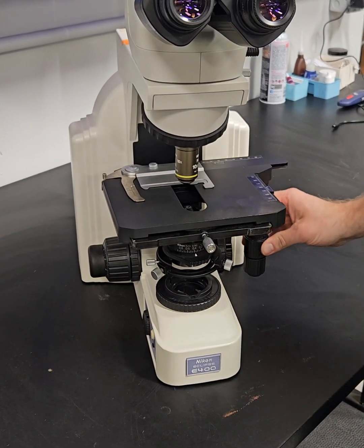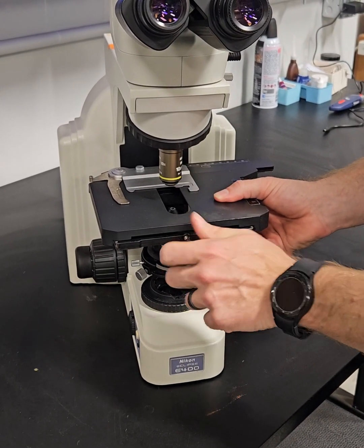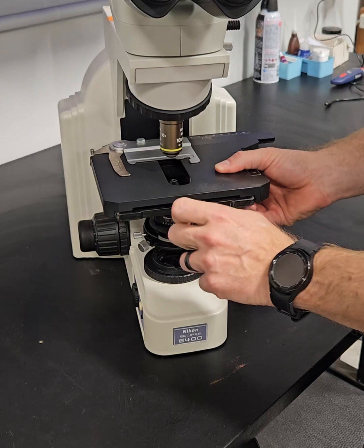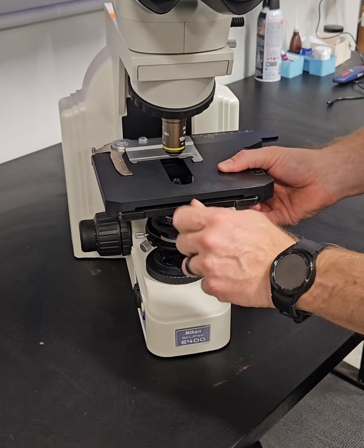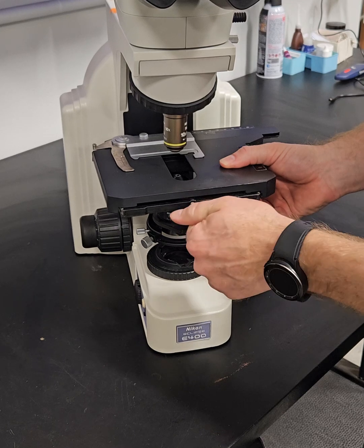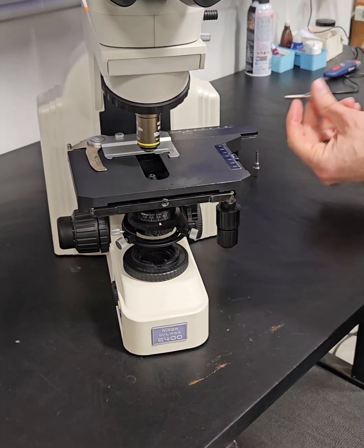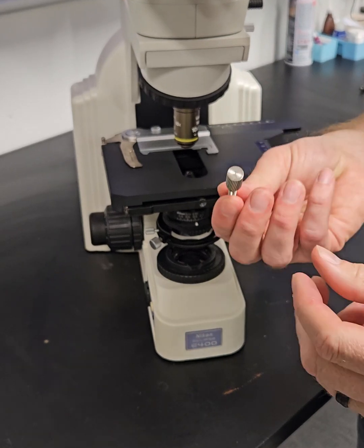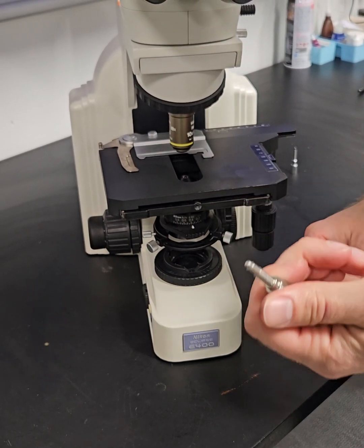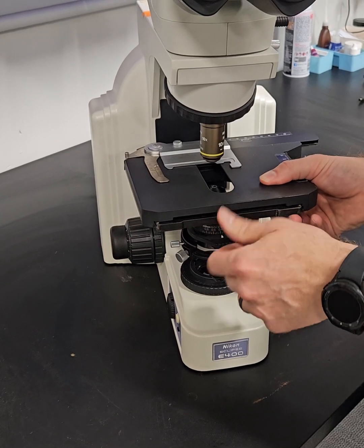So we have manufactured a solution to this. You can buy all these parts, disassemble this screw, take the C-clip off, the pin, replace the plunger on the end, or you can just pick up this all steel screw. That's not gonna fail. You're gonna replace it one time. It's not gonna break again. So we'll go ahead and thread that in.